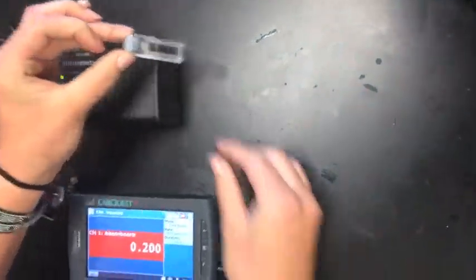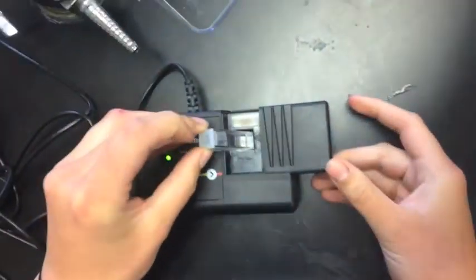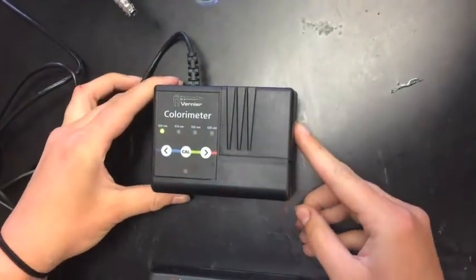When picking up the cuvette, make sure that you hold it with the ends of the lid. Next, place it into the colorimeter with the lid facing the line.